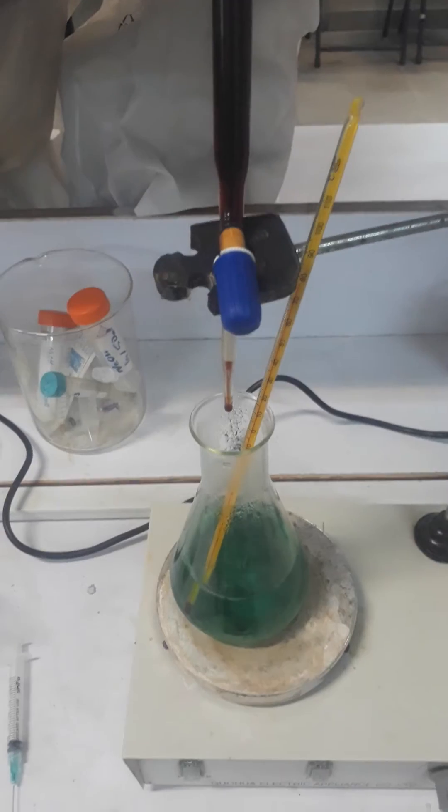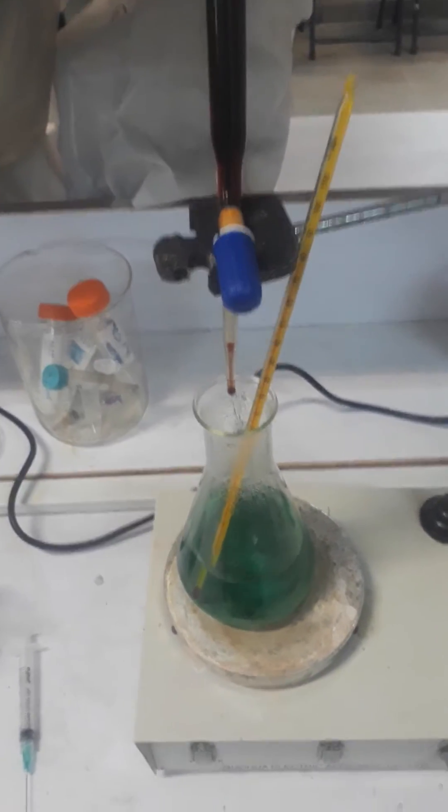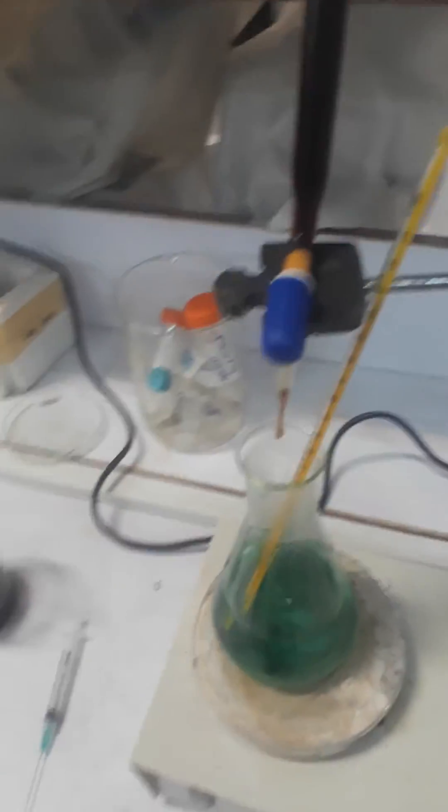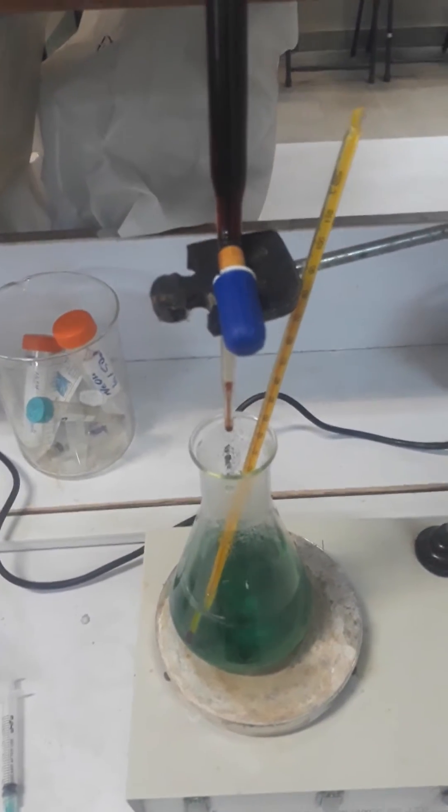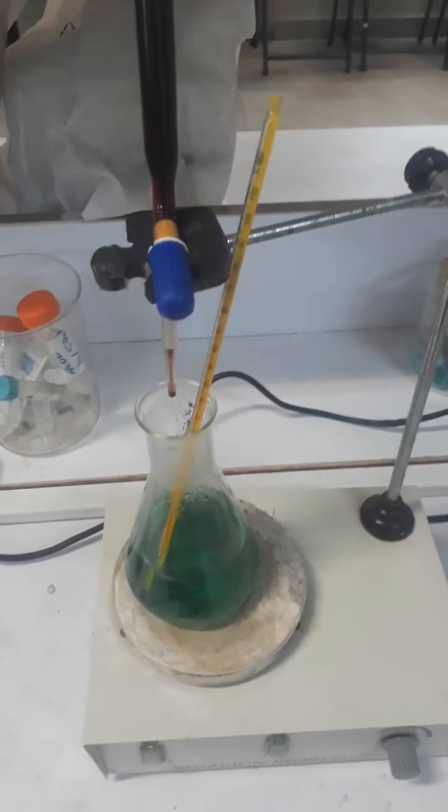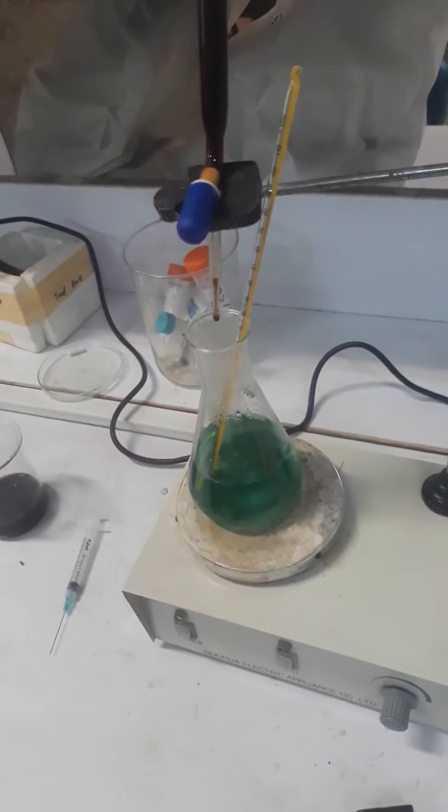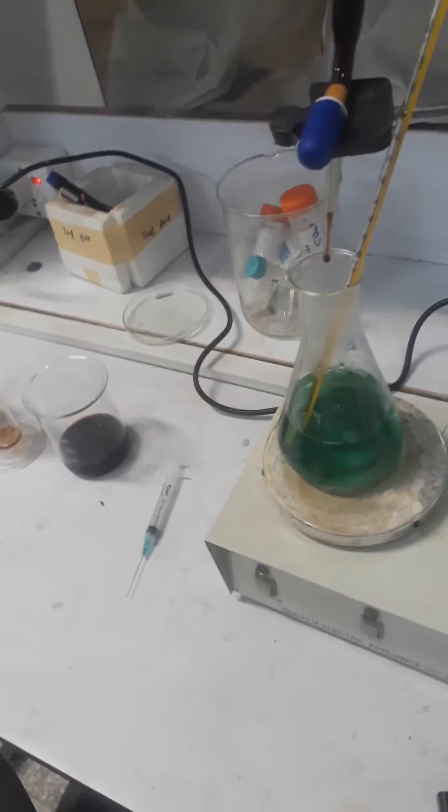And as you can see, when you add copper sulfate your salt solution is blue, but when you start doing a titration your copper sulfate salt solution turns to green, which indicates the formation of copper nanoparticles.